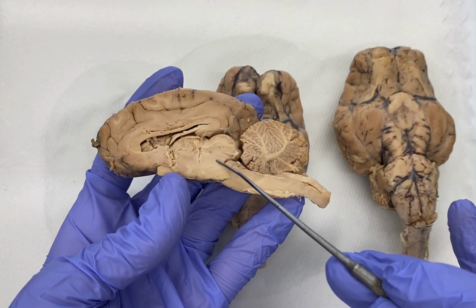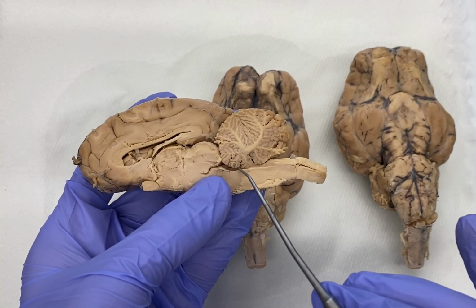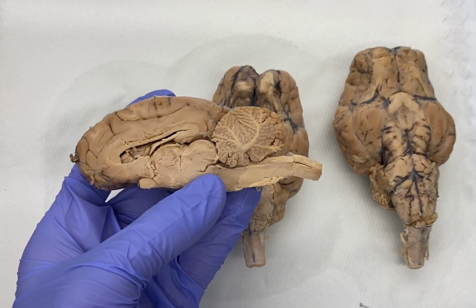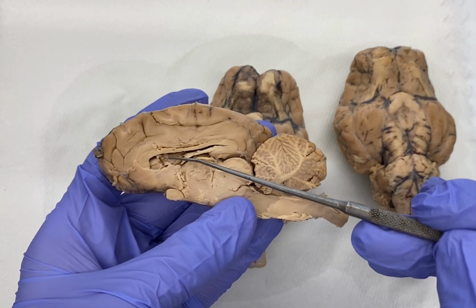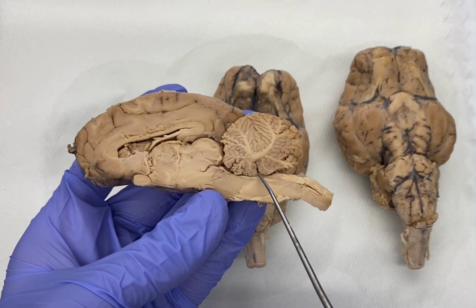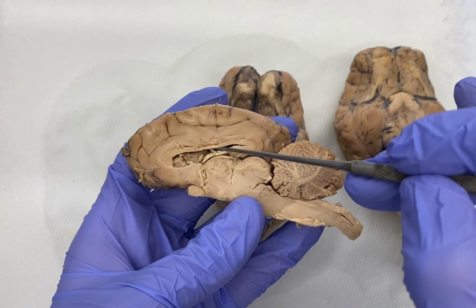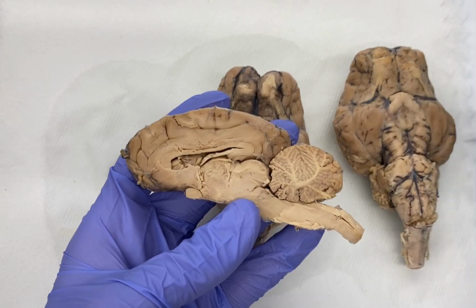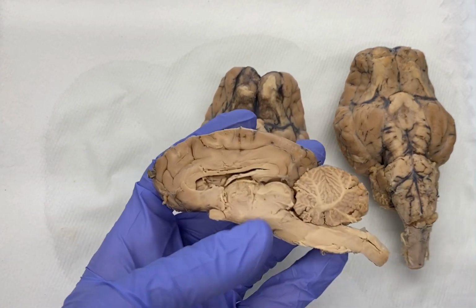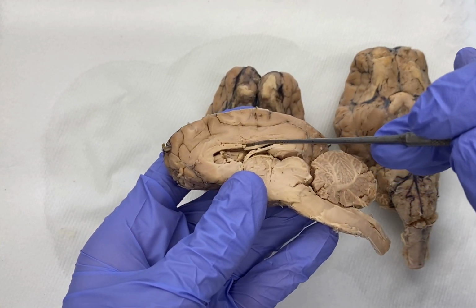And then there's a duct that extends down, and the fourth ventricle is usually just anterior to the cerebellum, kind of in this region here. This is the location where we would have our fourth ventricle. So: lateral ventricles, location of the third, approximate location of the fourth, all in this area right down in here. The cerebrospinal fluid is what is in these. There is a fluid called CSF, cerebrospinal fluid, and it exists in these ventricles.